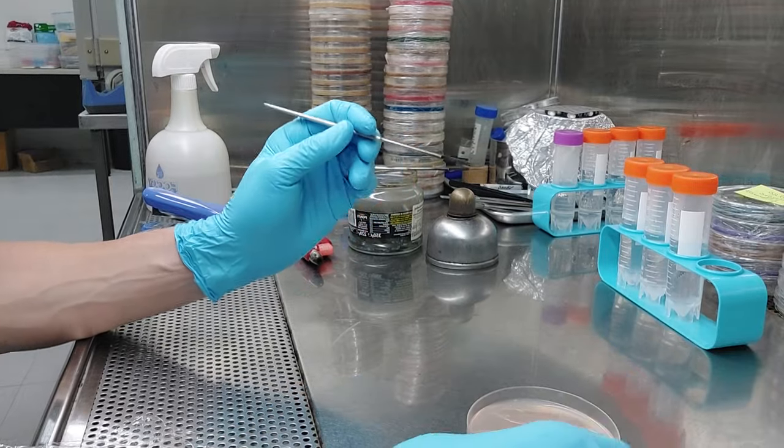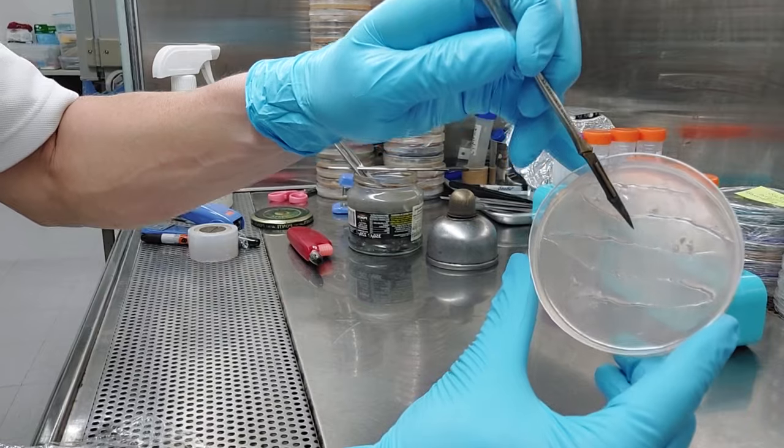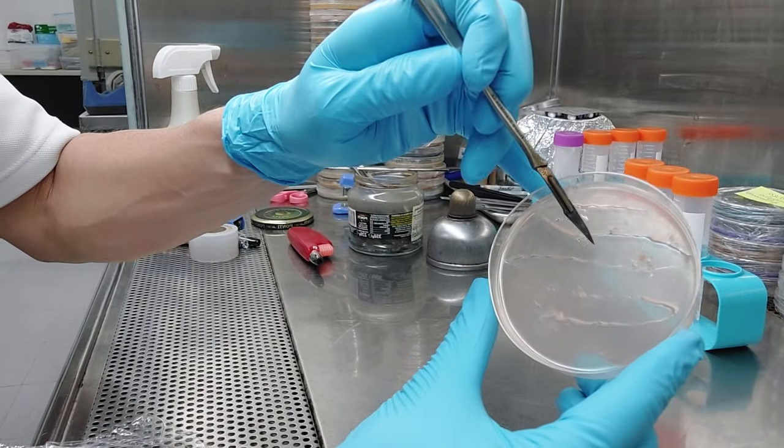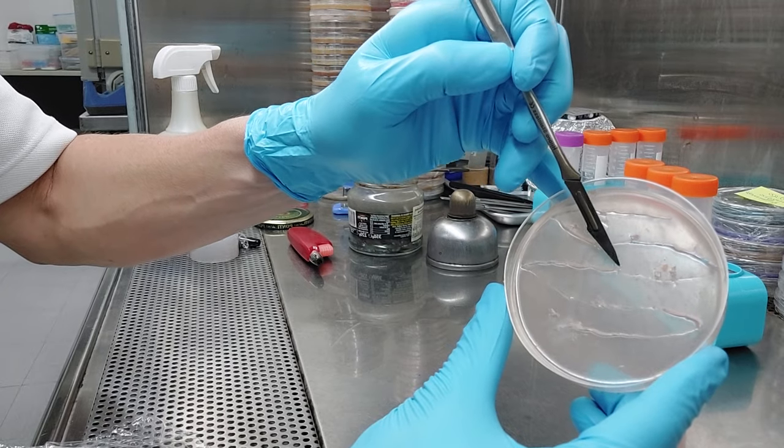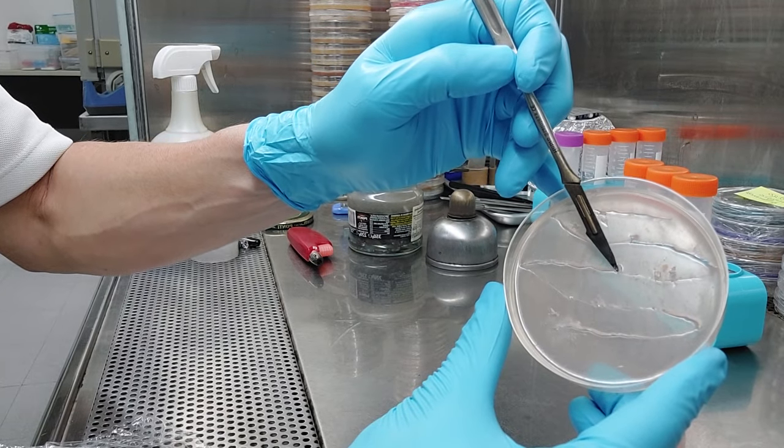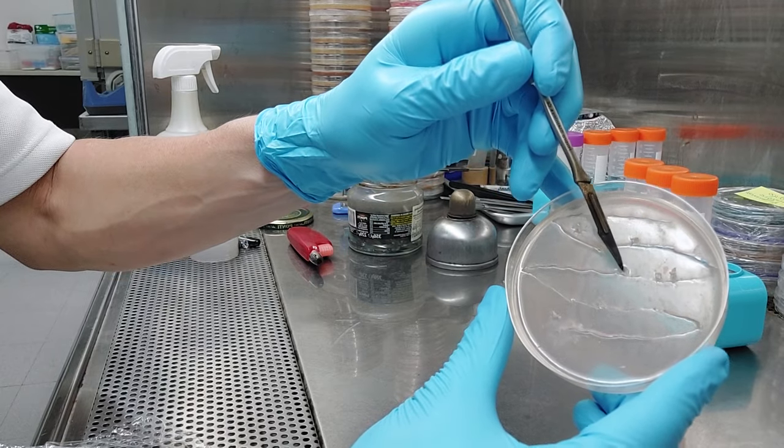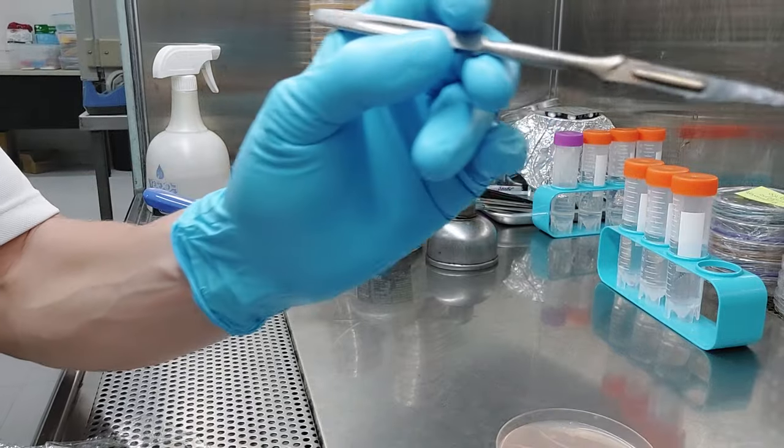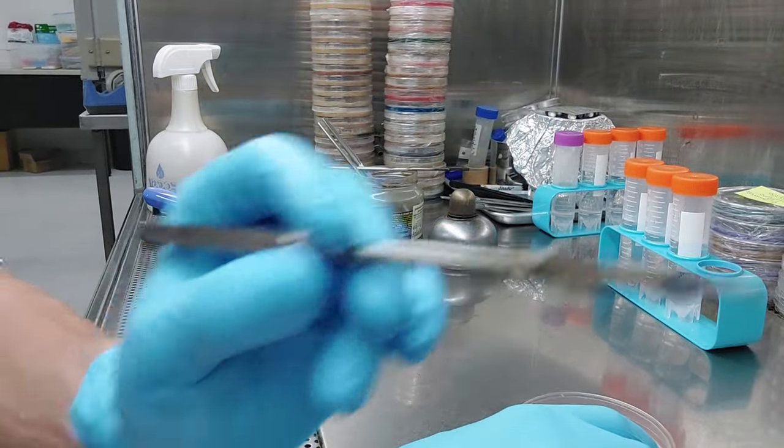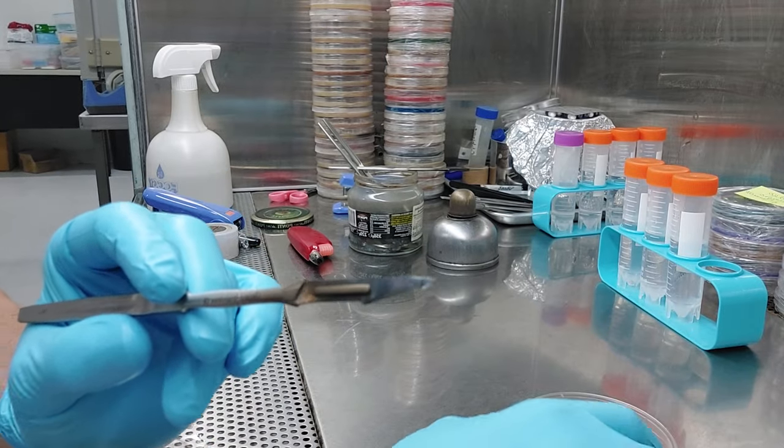Usually, I'll show you, so you come in here. You kind of make one, two, and then the third slice you kind of scoop under there. See, this is where I had trouble because this agar is not stiff enough. You can see there, little tiny piece. You want to get something smaller than that, right?